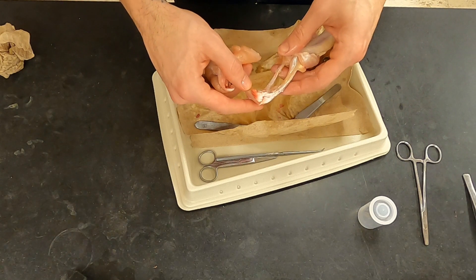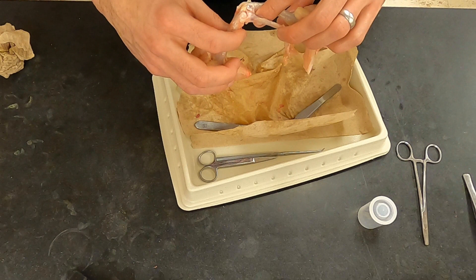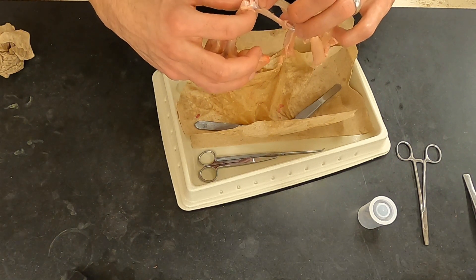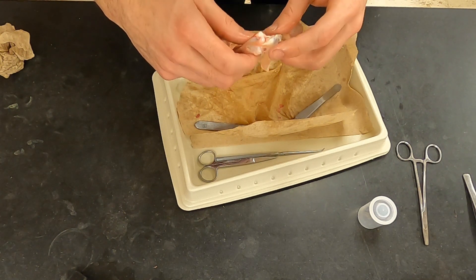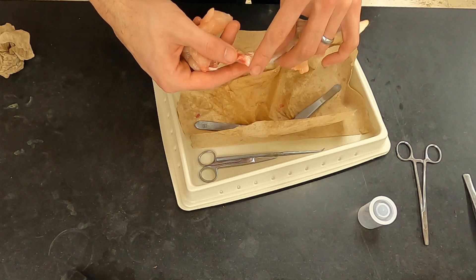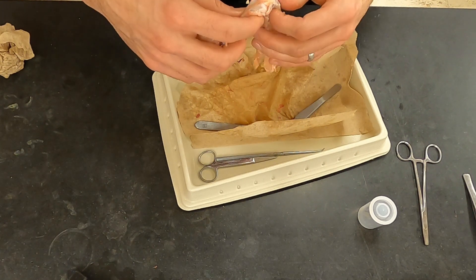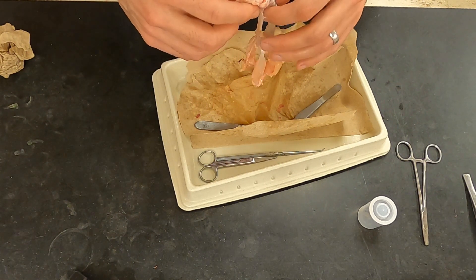Through this process of removing things, you can start to see what really held this joint together — what holds these bones together. There are some small ligaments here and here, the tendons that were connected to the muscle, and some more ligaments, all comprising the joint capsule, which was protecting this joint and keeping in the lubricating synovial fluid.